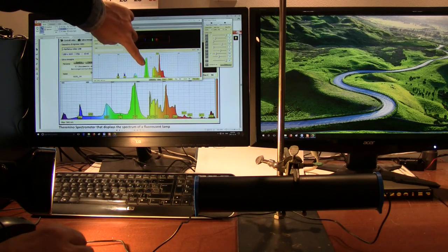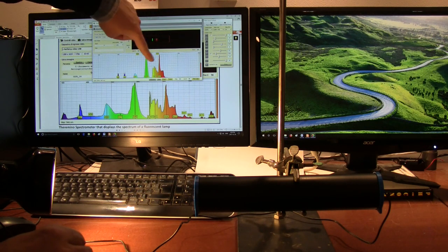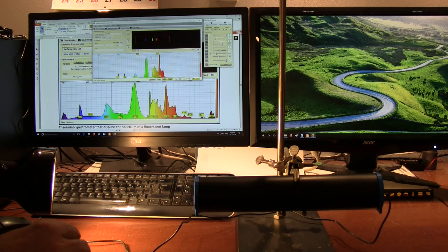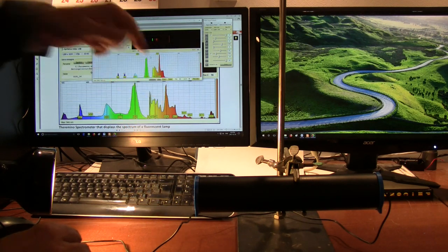You see this one's already at about 546, 545, but we can also adjust the upper 600 to bring this one into scale. And you can see once we've made our adjustments, then our spectrums match, and you can see we're getting fairly good resolution on the line, similar to their calibration graph.